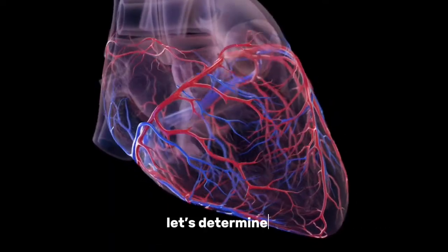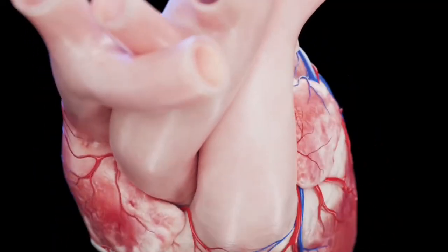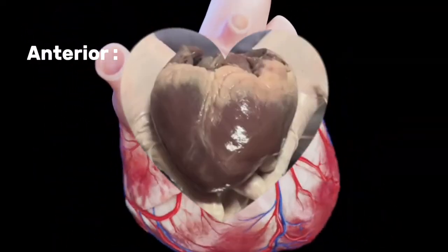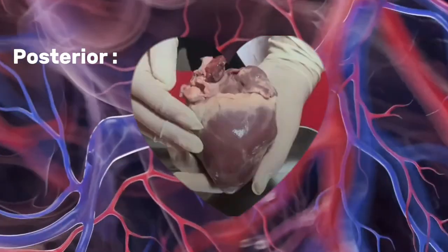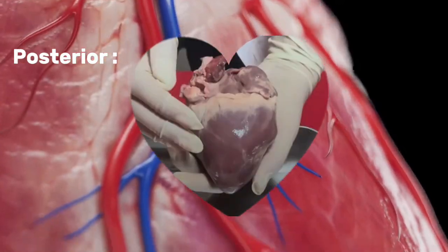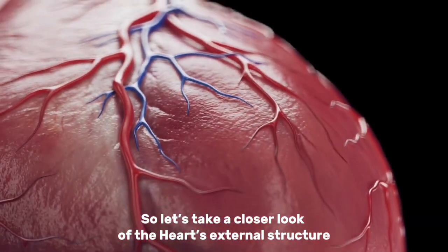Now, let's determine the frontal plane of the heart. This is the anterior plane of the heart, while this is the posterior plane of the heart. So, let's take a closer look at the heart's external structure.